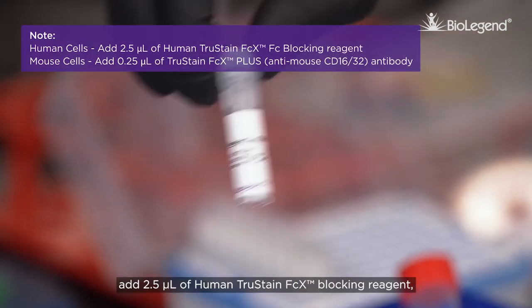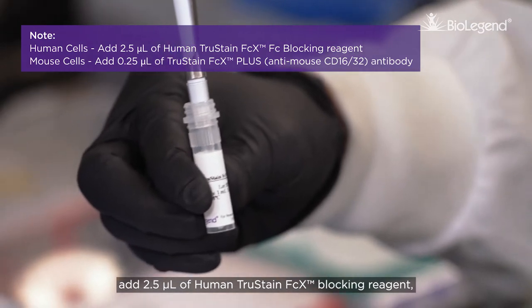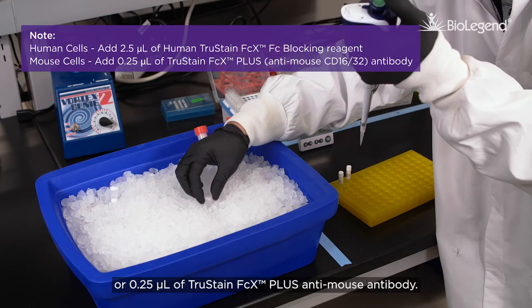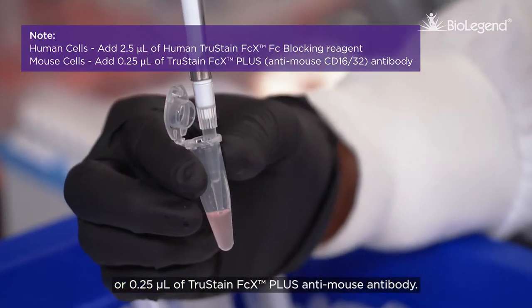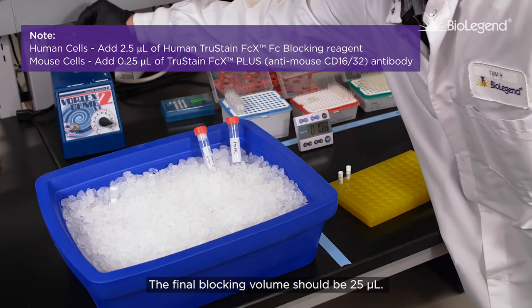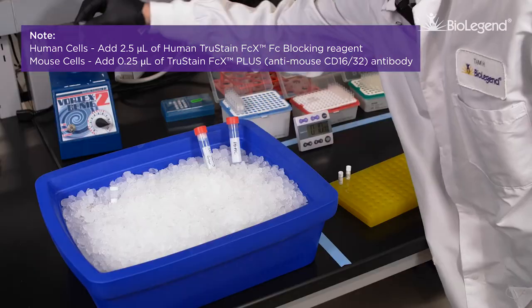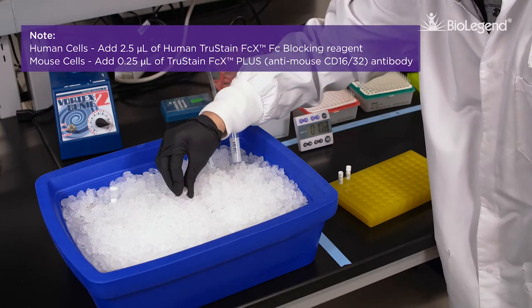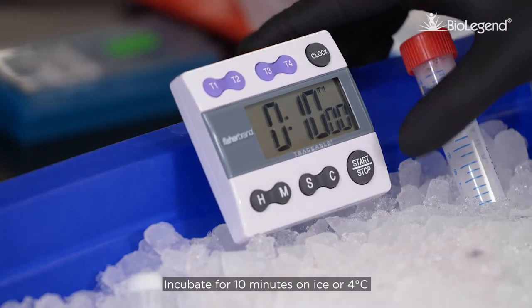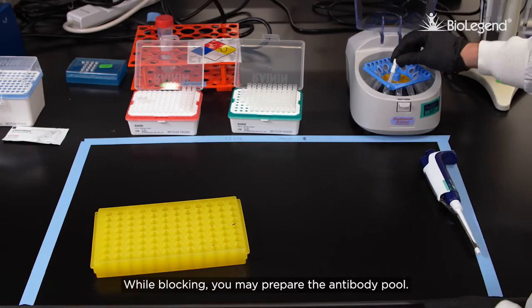To block cells, add 2.5 microliters of human TruStain FCX blocking reagent or 0.25 microliters of TruStain FCX Plus anti-mouse antibody. The final blocking volume should be 25 microliters. Incubate for 10 minutes on ice or at 4 degrees Celsius. While blocking, you may prepare the antibody pool.